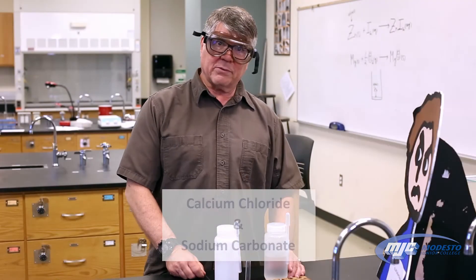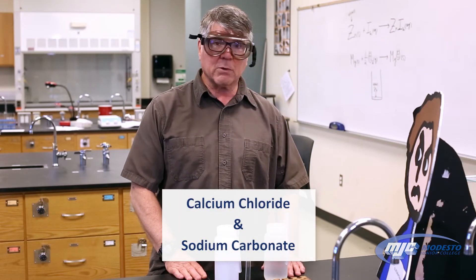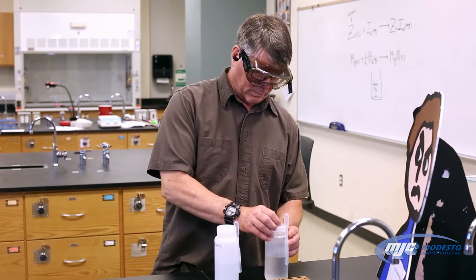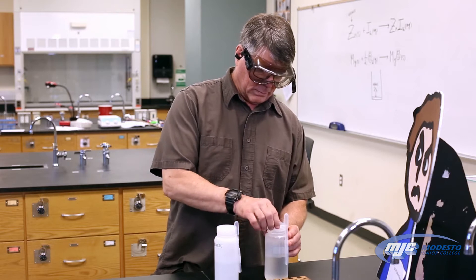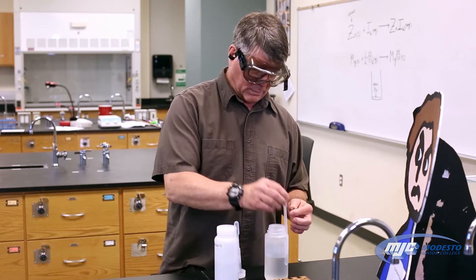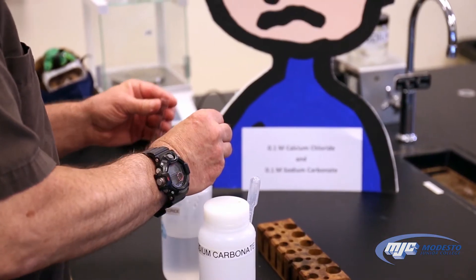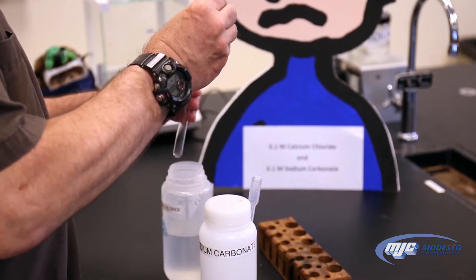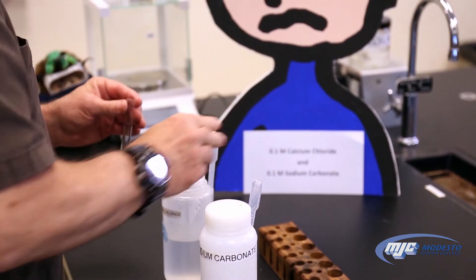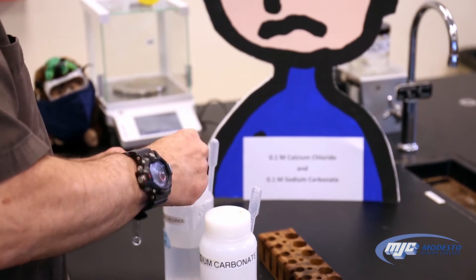This is the reaction, if any, between calcium chloride and sodium carbonate. Put the lid back on the container.